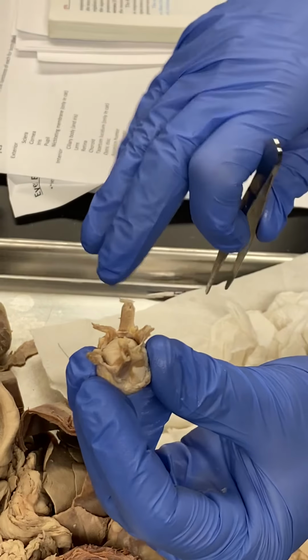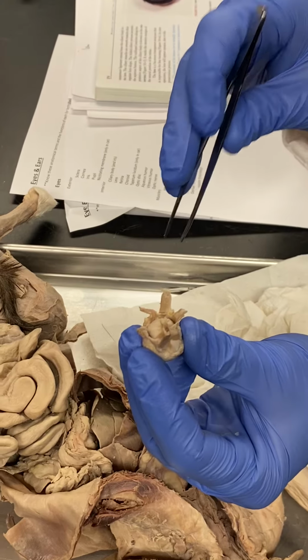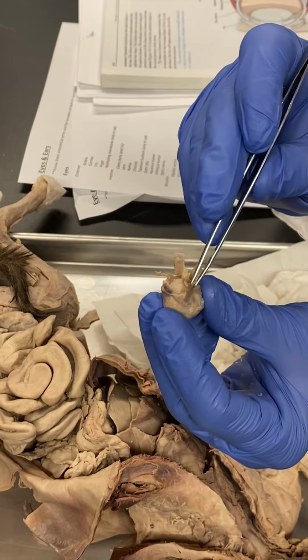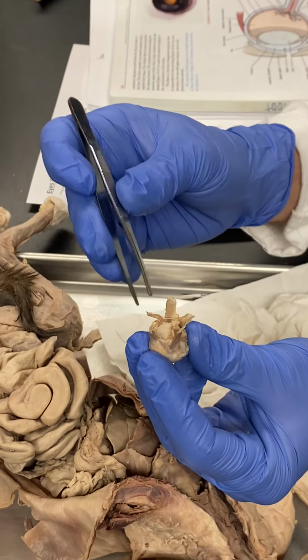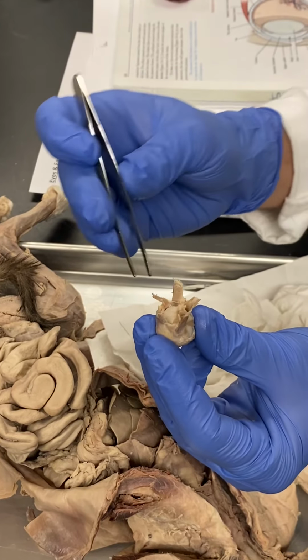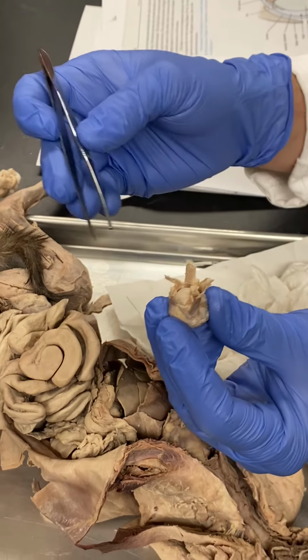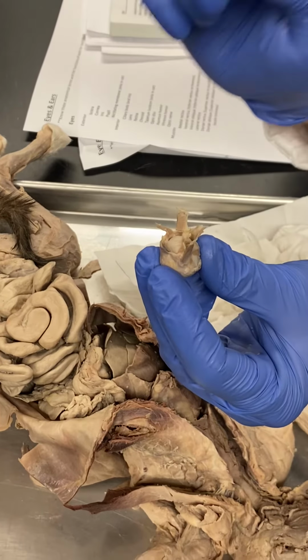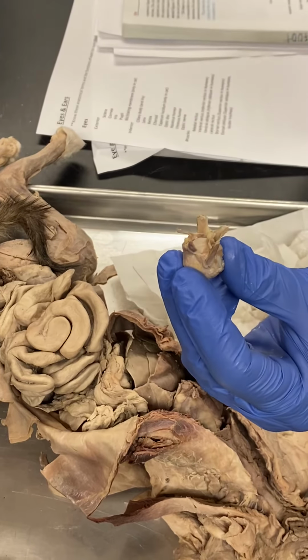So in a cat, it would be dorsal and ventral. In a human, it would be superior and inferior. So make sure you make that distinction. The dorsal muscles cross pretty immediately right over top of each other, okay? Whereas the ventral muscles are about the same thickness, but don't necessarily cross immediately at the eyeball. They eventually cross, but they don't do so immediately. So those are subtle differences. The ventral muscles are here, the dorsal muscles are here, okay?